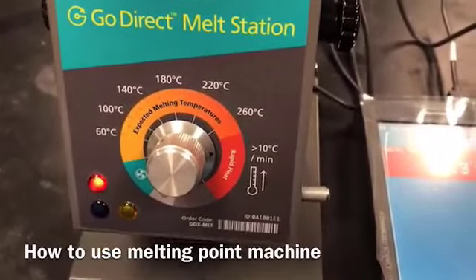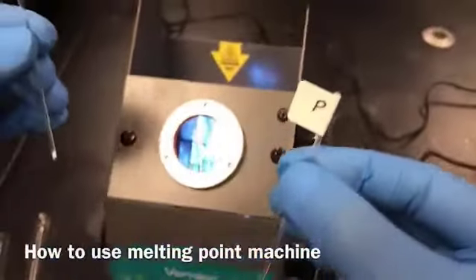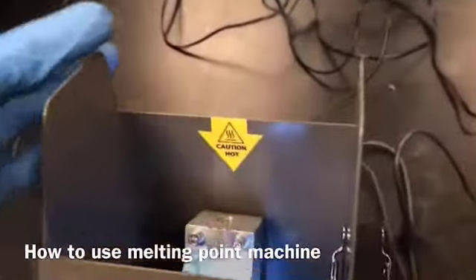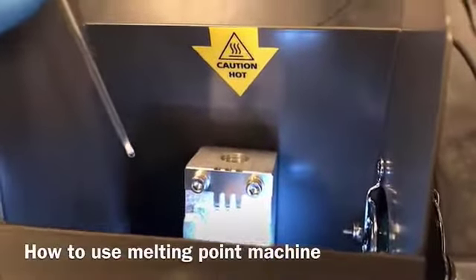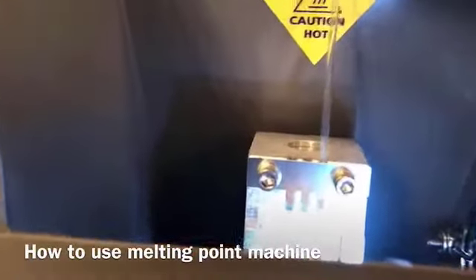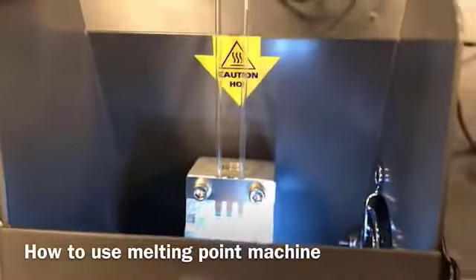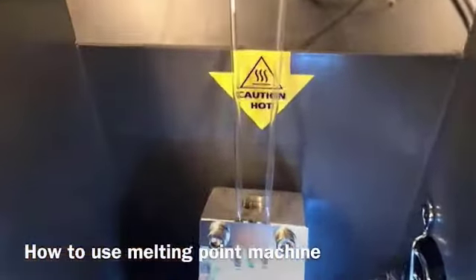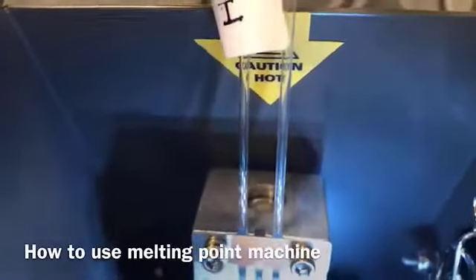Now, in the meantime, you can place your capillary tubes. Here you can see there is an aluminum heating block, right? And there are slots made. So I'm going to put my sample pure, let's say here, and impure is here. So there are 3 slots given. You can put it right there.